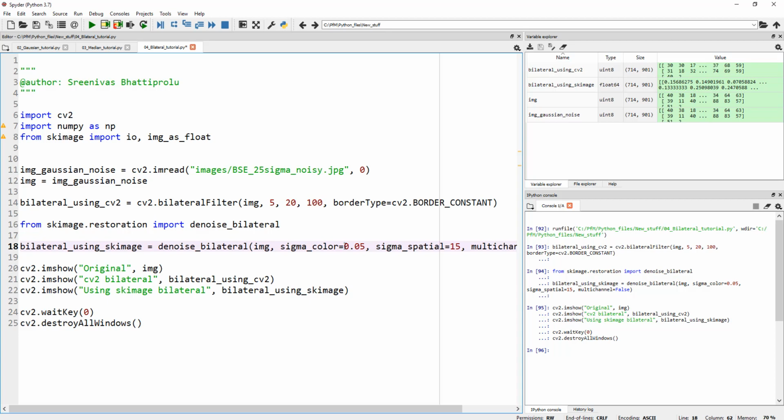I believe if you use a very large sigma color value, then the filter almost becomes a Gaussian blur filter. Okay, and when you increase the spatial filter to a large value, that smooths larger features in a way. So go ahead and play with this and see how it works on your specific images. But here it is, bilateral filter. After all this lecture, I should mention that I've seen bilateral work fine on, for example, some MRI images.